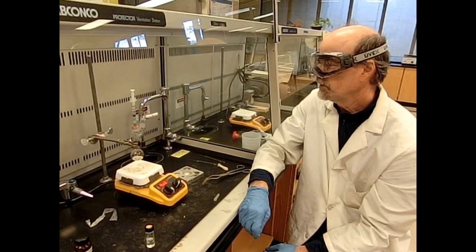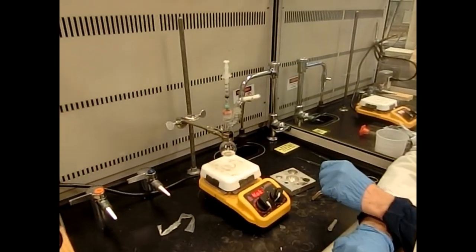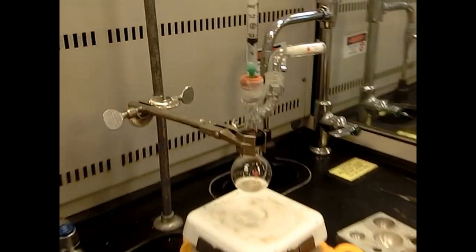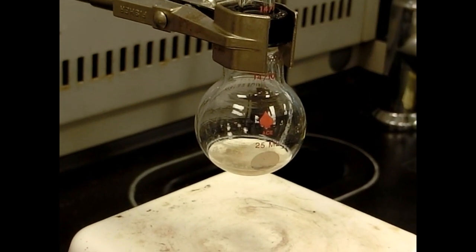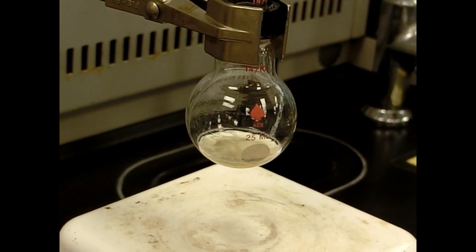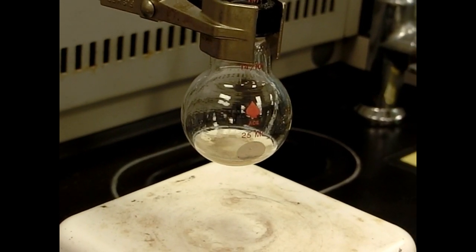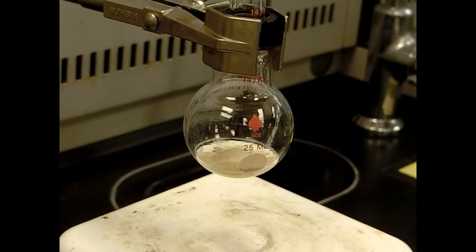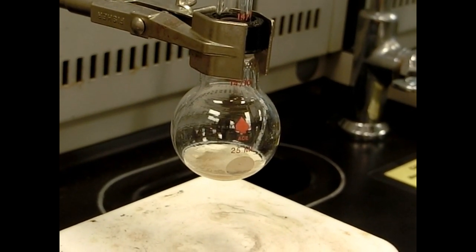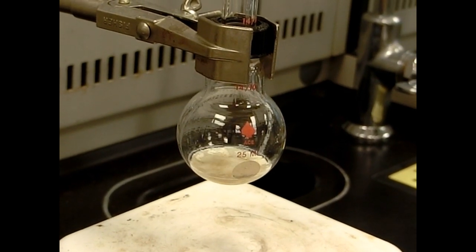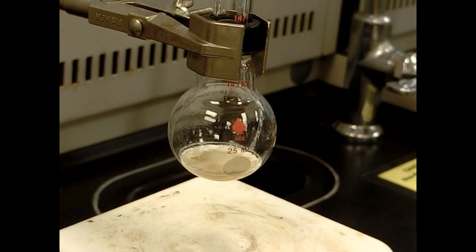And here we're doing pretty well. See the darker color? The bubbling is happening on its own. It's an exothermic reaction, and it's refluxing on its own accord. That is looking really good. This is what Grignard looks like when it's moving on. Again, we have probably another 15 minutes to a half hour to let this come to completion. We will also want to look for the magnesium chips to get smaller and smaller as they dissolve to make the Grignard. But so far, we're looking really good.